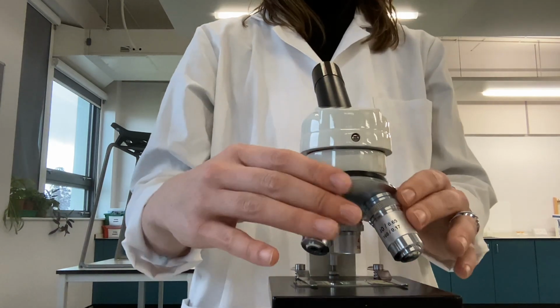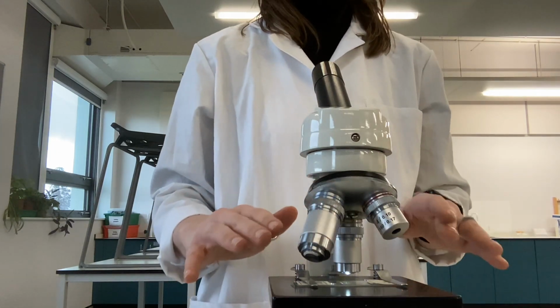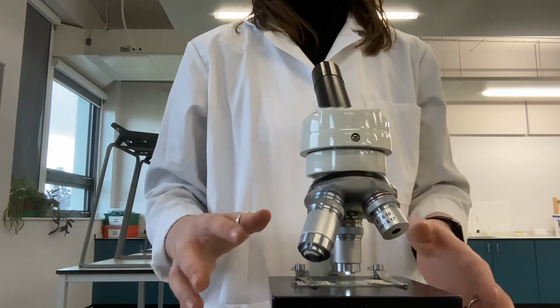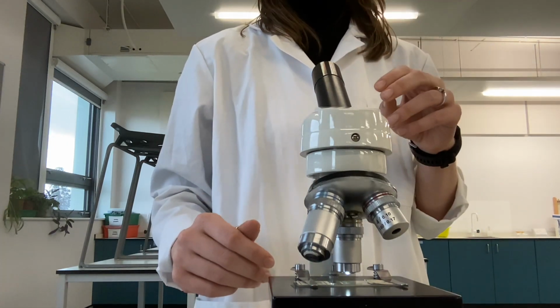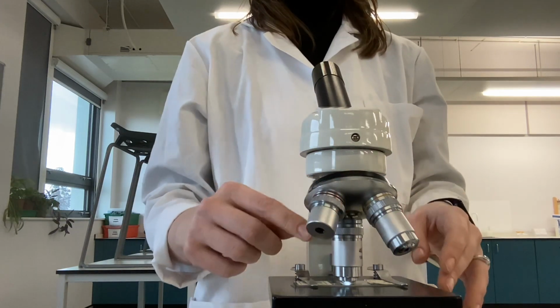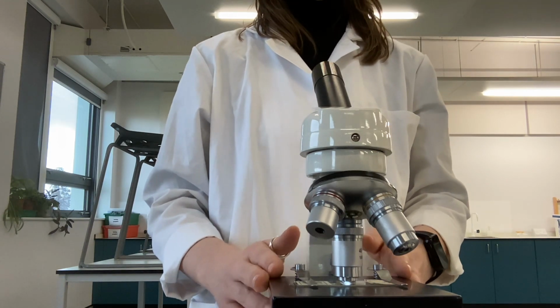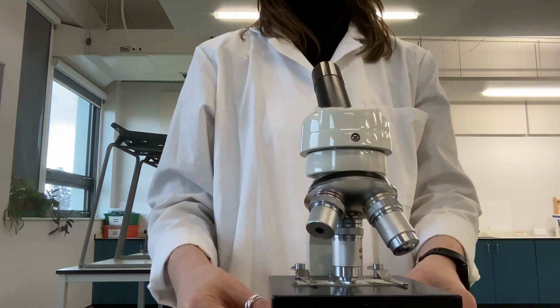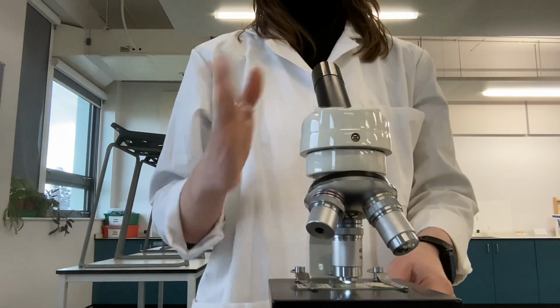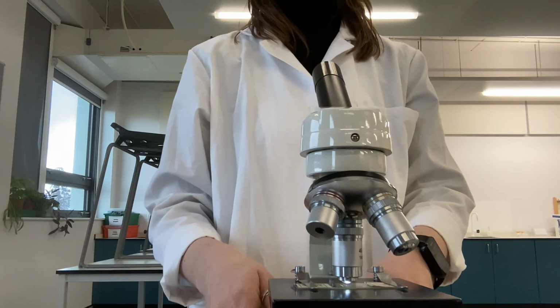At that point, you can now move to the ×10 magnification. Do not move the slide. What we want to do is just increase the magnification but not move anything out of our field of view. Once that is all focused, we can then move to ×40. When changing to ×40, be careful that it is not going to hit the stage or the slide. You may need to lower the stage away as you turn to ×40, and then you can look through the eyepiece lens and refocus in for your eyes.